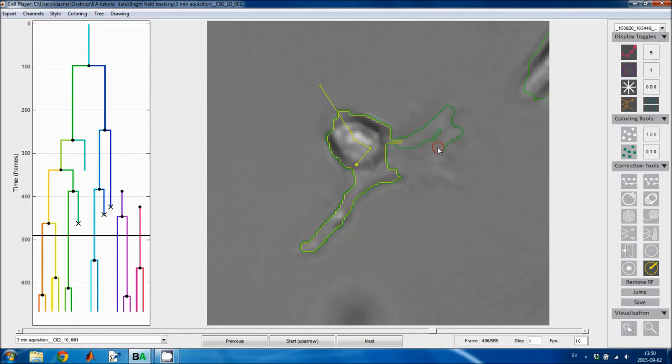Usually segmentation editing is not necessary, but if you get something which is off by a lot, if you get a huge bubble or something which is segmented as a cell, you may need to do it. Or if you're very interested in detailed morphological analysis, then you may also need to perform the segmentation editing. But usually you don't do this step. You erase by right clicking like this.